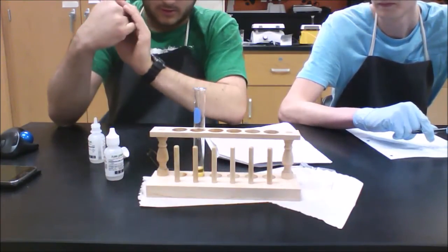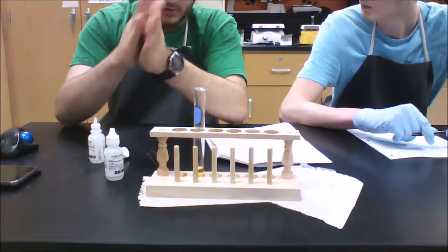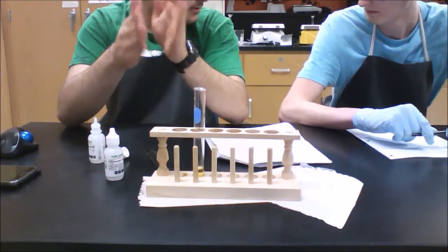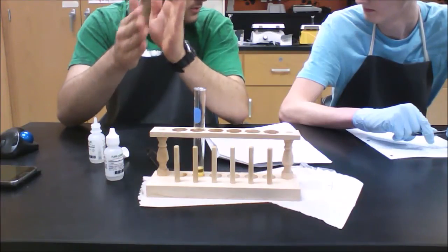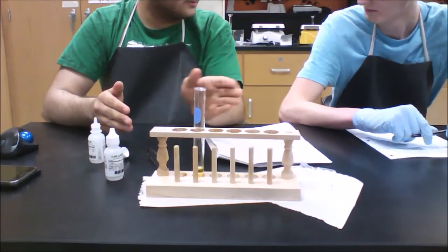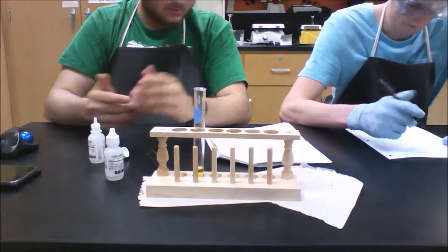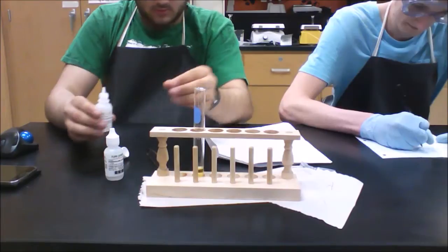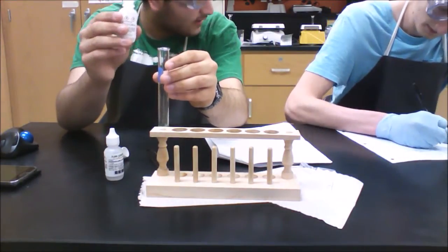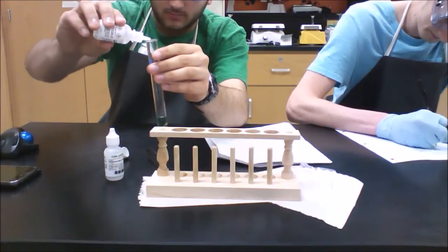Now what we're gonna do is shift the equilibrium back and forth once or twice just to make sure which side is which. So like add a little more of each to make sure the equilibrium shifts back and forth to show them. Okay. So let's start with adding actually more sodium hydroxide. So we're gonna add 5 drops of sodium hydroxide.